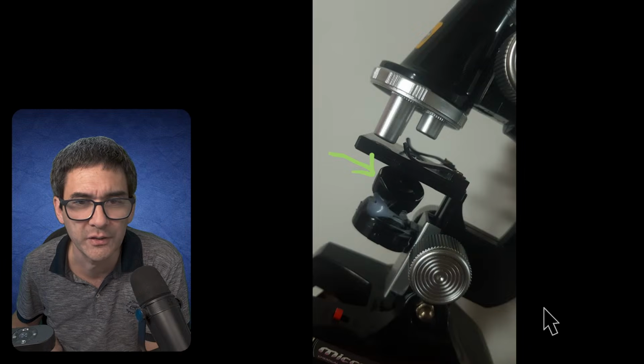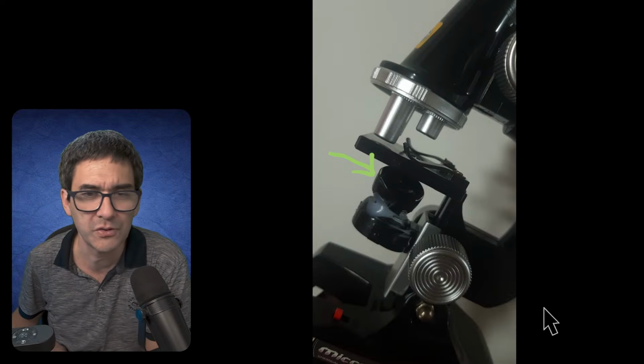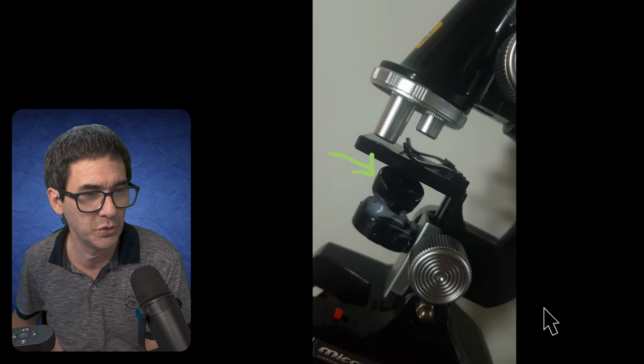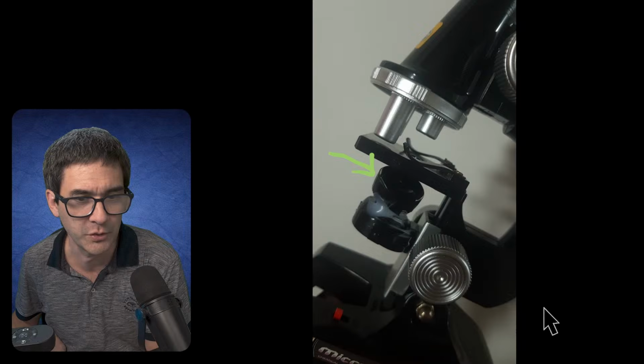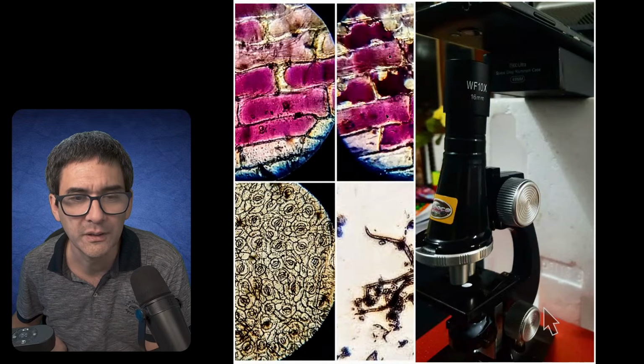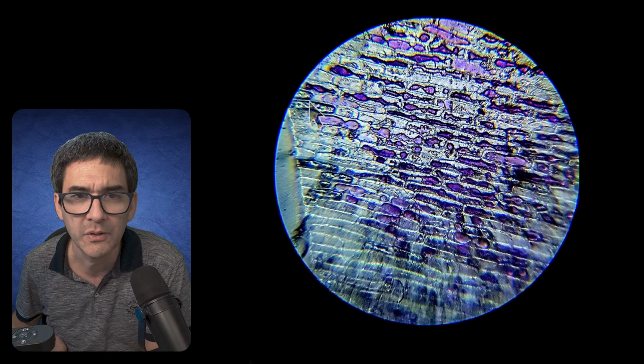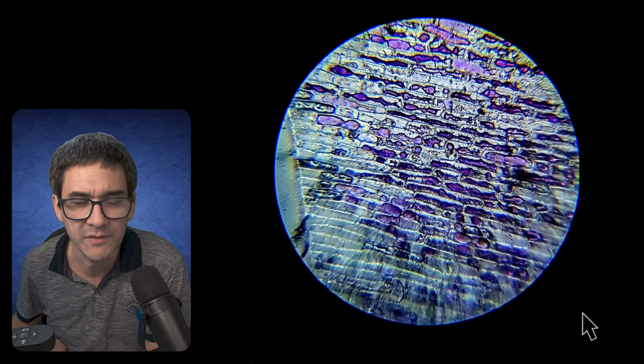So it shows that even those basic microscopes are able to produce surprisingly good quality. That's actually the reason why I wanted to show it to you. This one is a little small, but of course you can see that over here on the side it's a little bit blurry because it's not a plan objective, but that's fine.